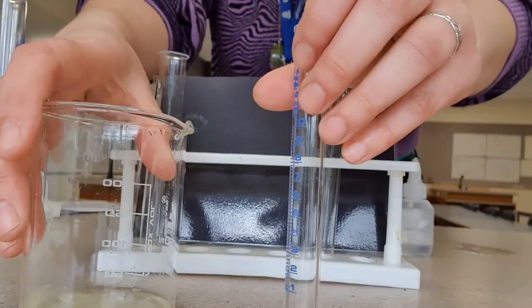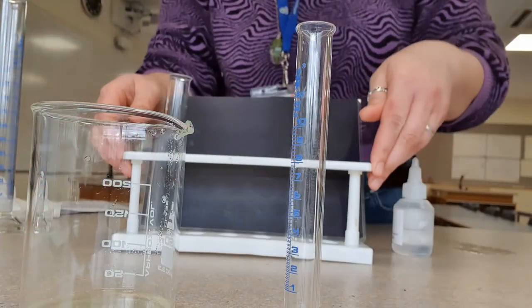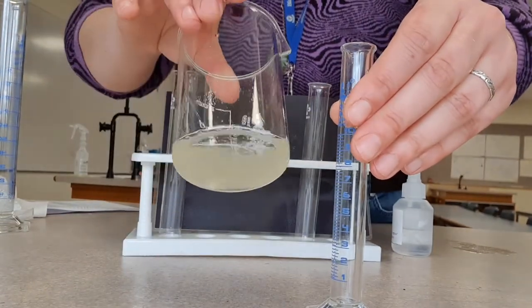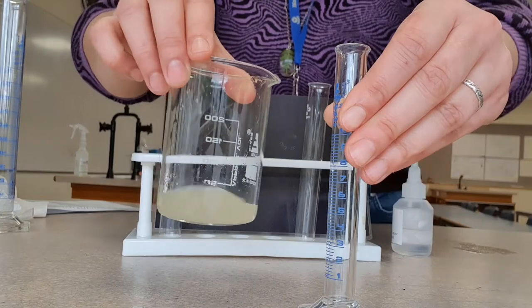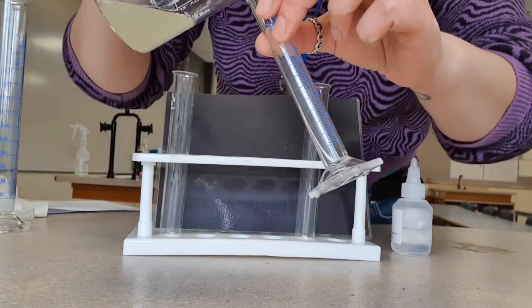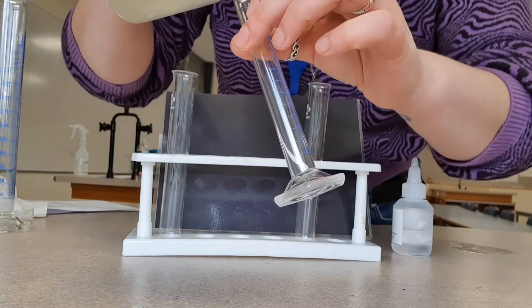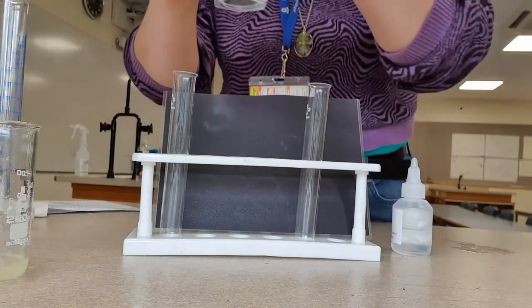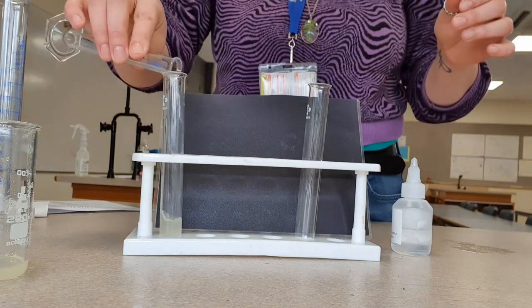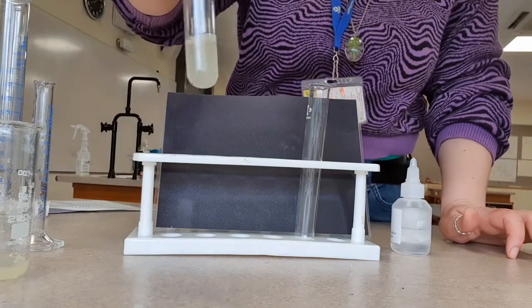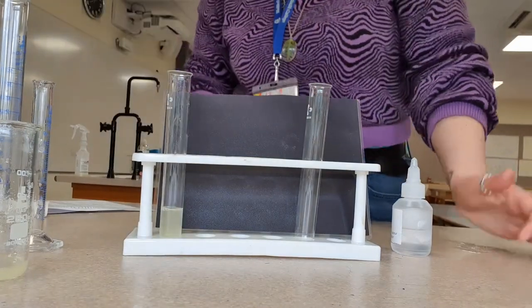Okay we're back from a different angle. Hello. So here we have our banana cells, or yeah cells that I've poked holes in the membrane with my soap. Measuring out 5 ml. Lovely. Into the test tube. So you can see that there. Now the fun part.